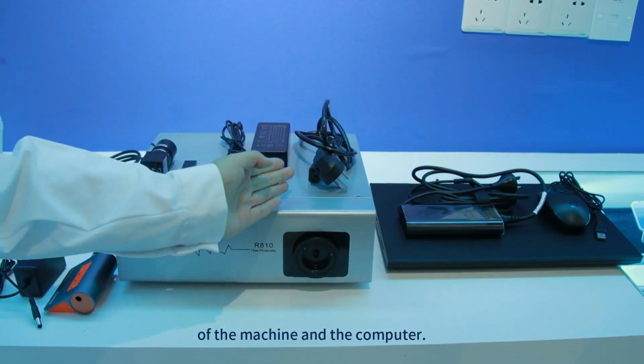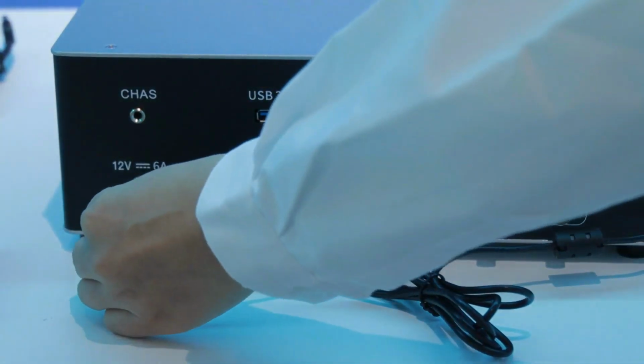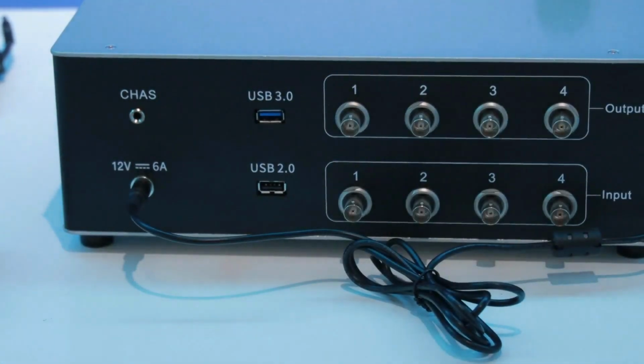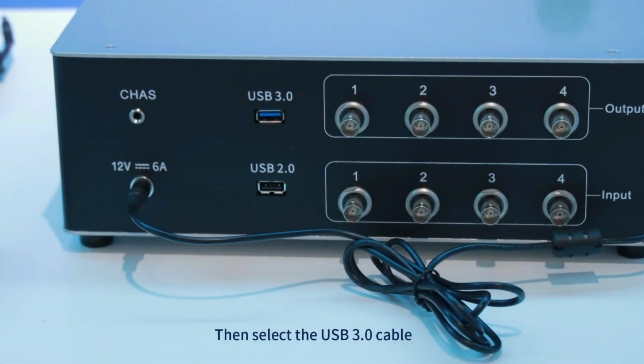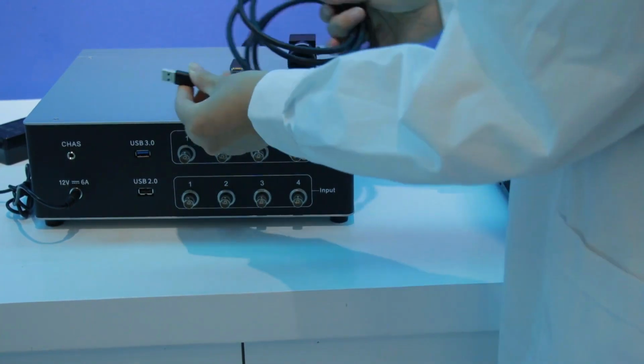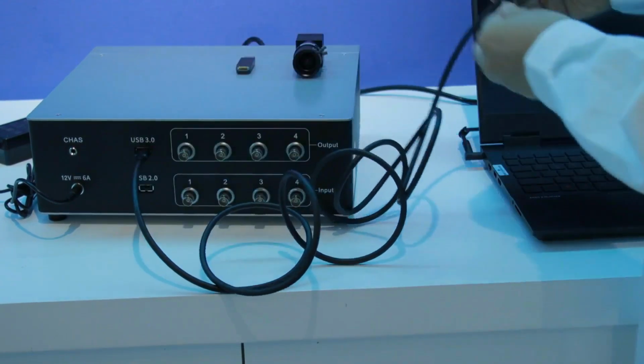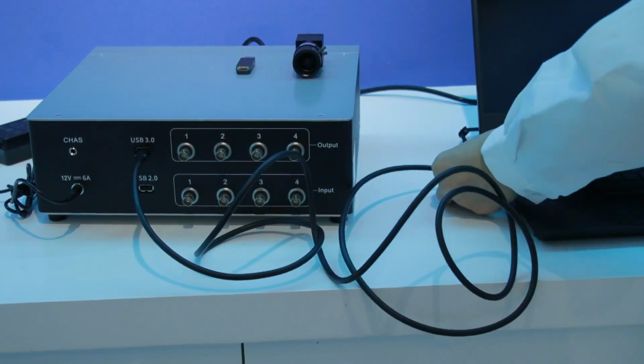First, connect the adapter and power supply of the machine and the computer. Then select the USB 3 cable to connect the USB 3 interface on the back of the machine to the USB 3 port of the computer.